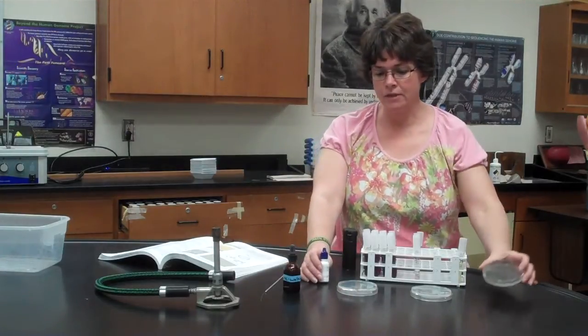So before you do anything else, you're gonna look at them under the microscope. Each of the 4 species will be on a separate plate, and you're gonna look at their shape and whatever structure you can see. Then, using the loop, you're gonna be sterilizing it like you've done before, and you're gonna take the 4 specimens from the plates and put them into the appropriate glucose, maltose, sucrose, and lactose tubes, okay? Once again, you don't need a lot. You don't need to gouge into the agar. 1 colony is fine, okay?